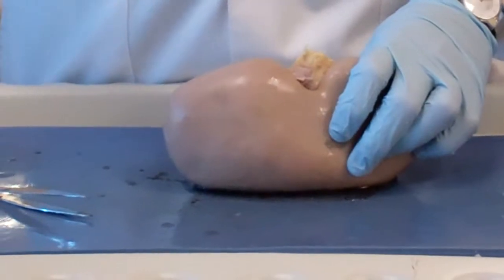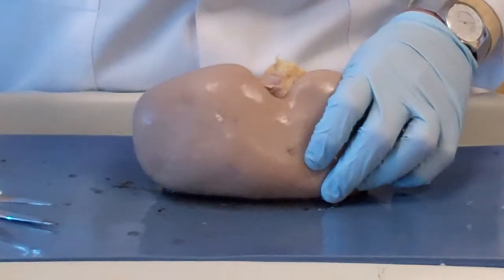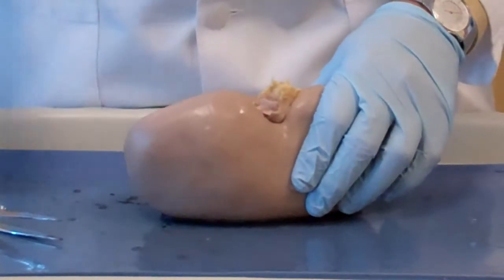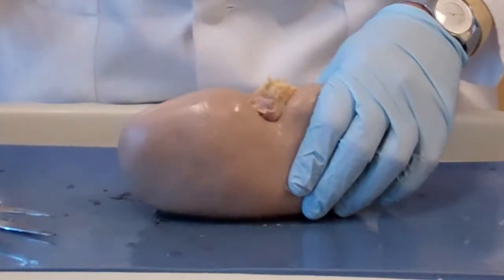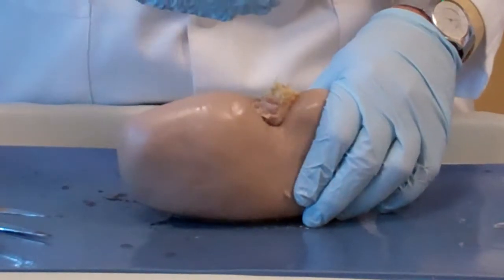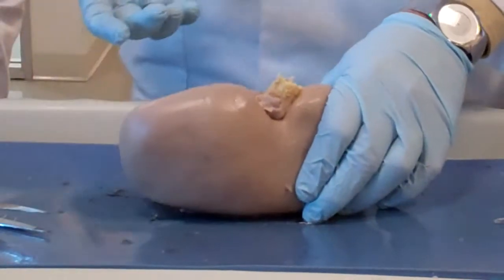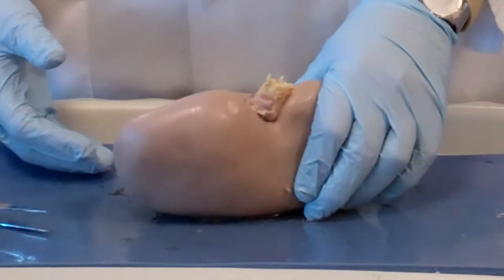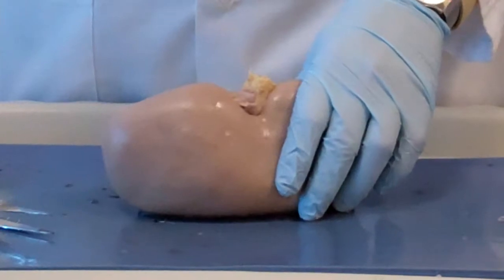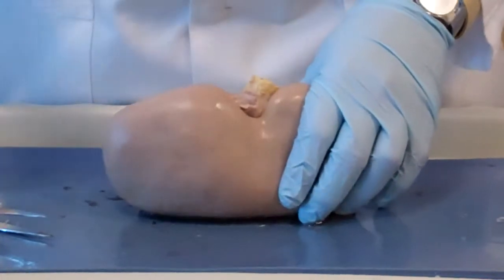Now we can see what you see in the hilus. In any organ, you're going to see an artery and a vein. In the hilum, there is an artery and a vein that supply the organ and take the blood from it, okay? And the structure that's supposed to be there. So in the lungs, you're supposed to have what? A bronchus. In the kidney, you're supposed to have what? A ureter. In the spleen, you're supposed to have artery and vein, and there is a hilum of the spleen as well. But the spleen is a lymphoid organ, so you don't have a third structure. But technically, it's the umbilicus of the organ that gives it its blood supply mainly, and nerve supply also, okay?